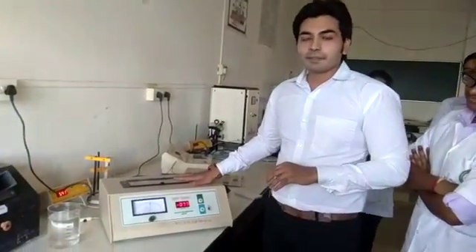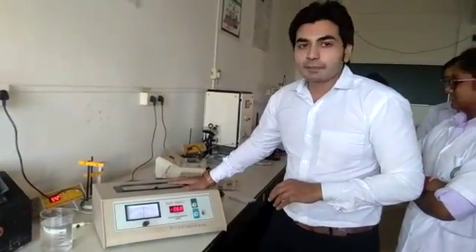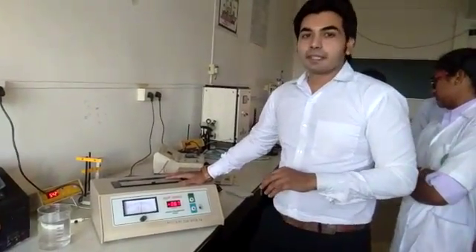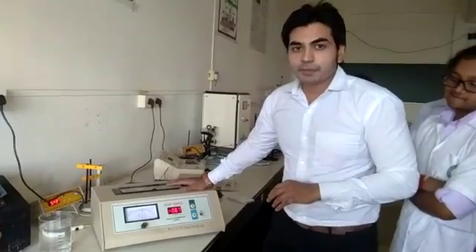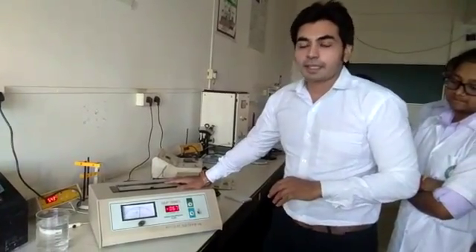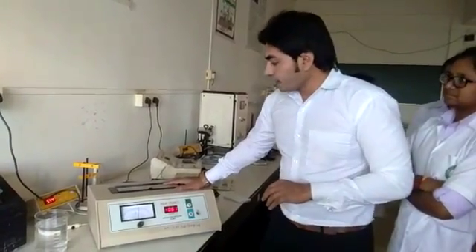This instrument is called a polarimeter. It calculates the angle of rotation based on optical activity.